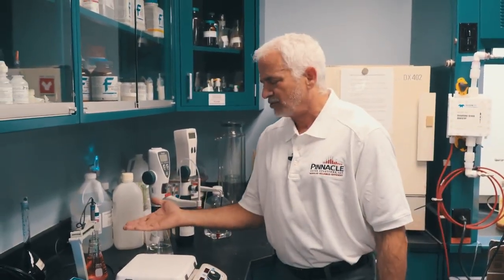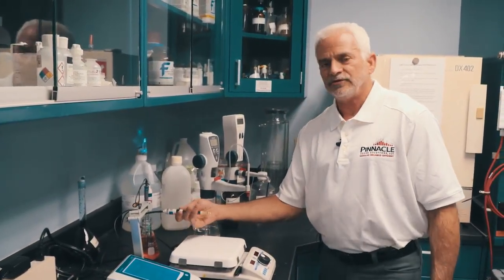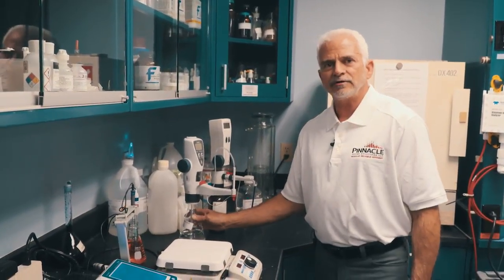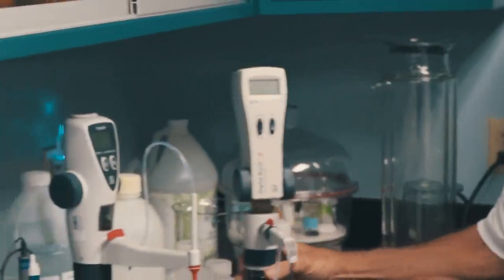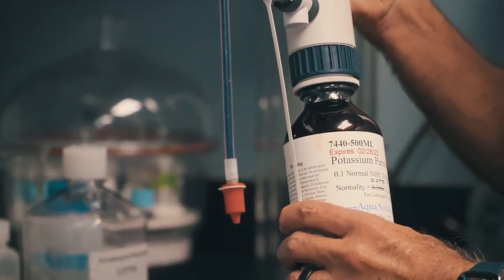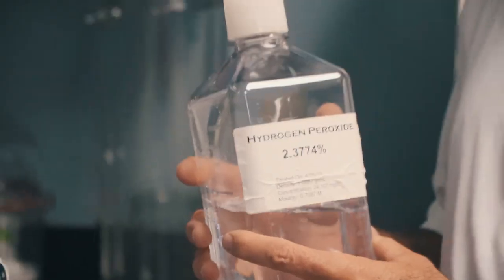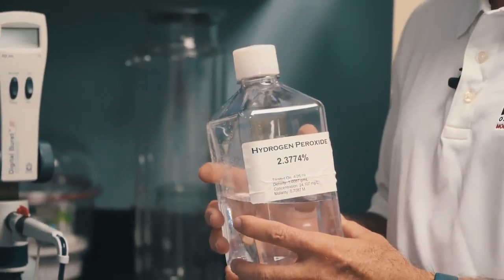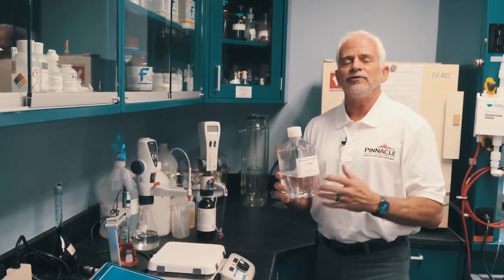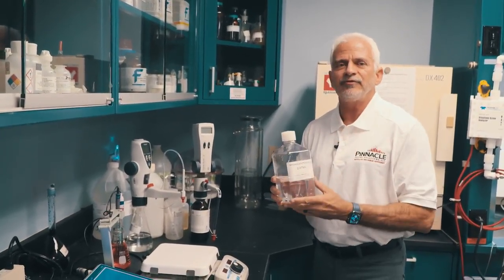Of course, you have a traditional pH meter along with a TDS probe for measuring the total dissolved solids. We also do titrations for alkalinity, total alkalinity. In addition to that, we use a potassium permanganate solution that's a standardized normalized solution for titrating for hydrogen peroxide. This is very important for our AOP studies because we need to know the exact concentration of the hydrogen peroxide that we use for dosing into our reaction flask, when we introduce ozone and the peroxide at specific ratios.